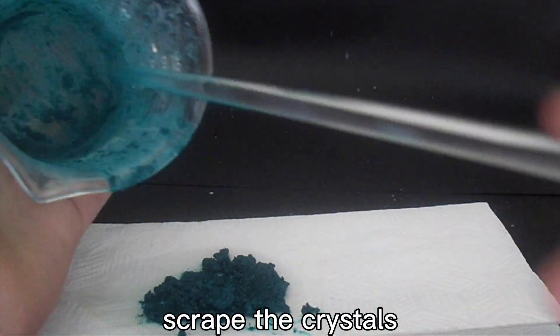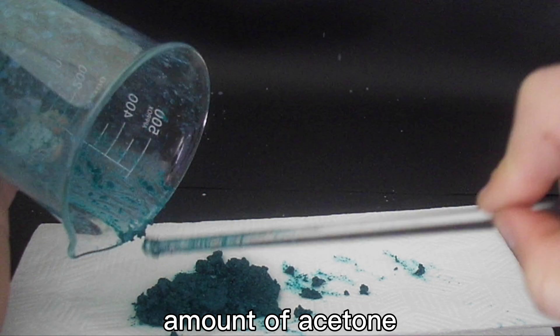If you find it hard to scrape the crystals out of the beaker, you can just add a small amount of acetone.